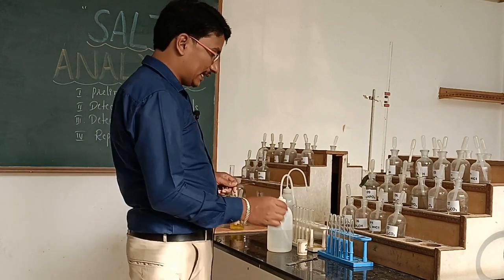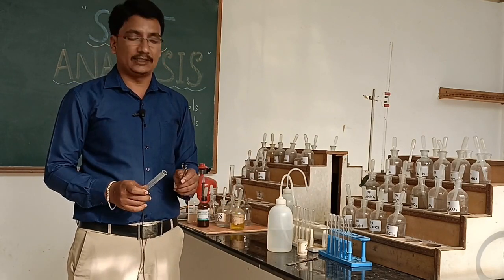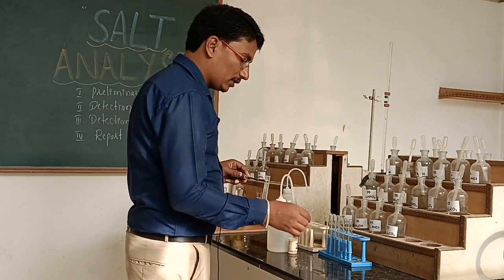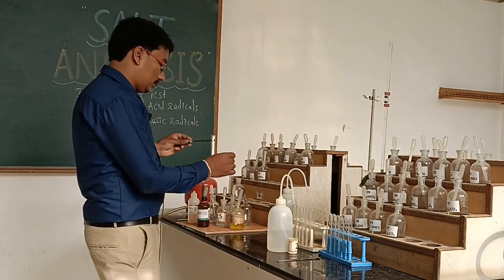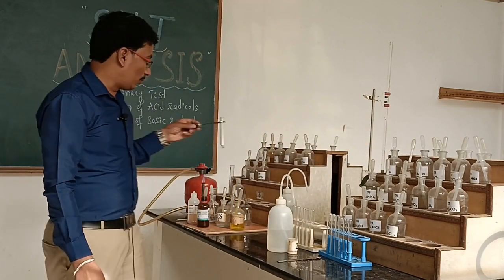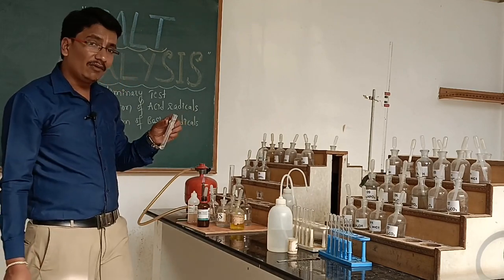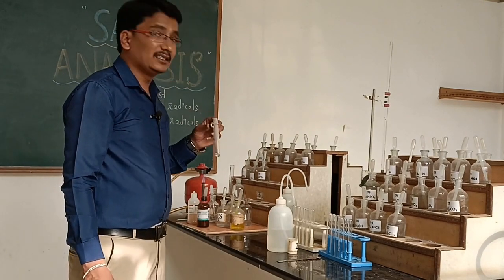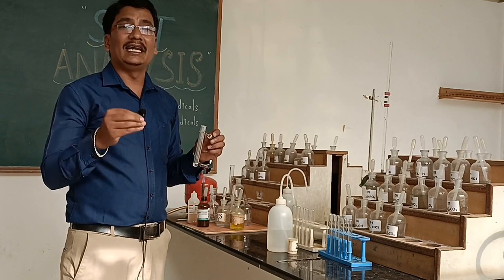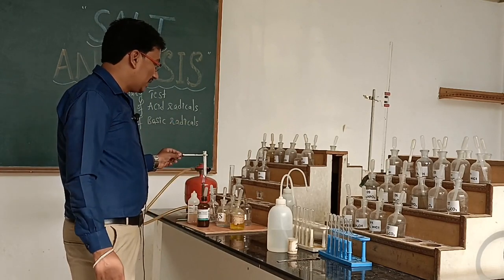For the detection of the basic radical of Salt 2, we follow the same procedure, starting from the zero group. Salt plus NaOH is heated, and we observe the smell of ammonia. This indicates the presence of ammonium ion. We then conduct the confirmation test — dipping a glass rod in concentrated HCl at the mouth of the test tube also indicates the presence of ammonium ion.